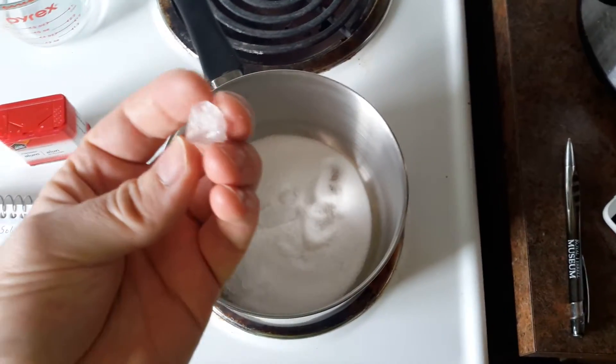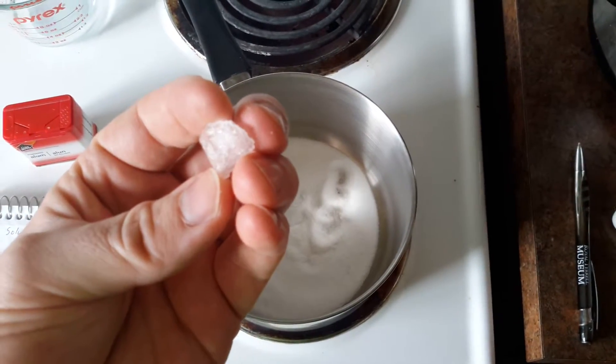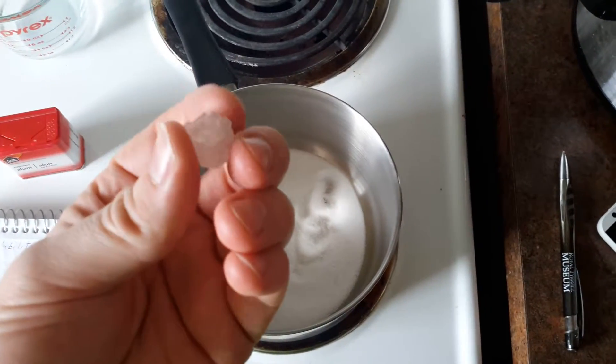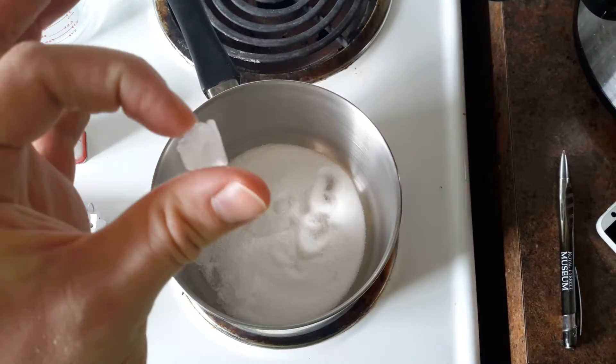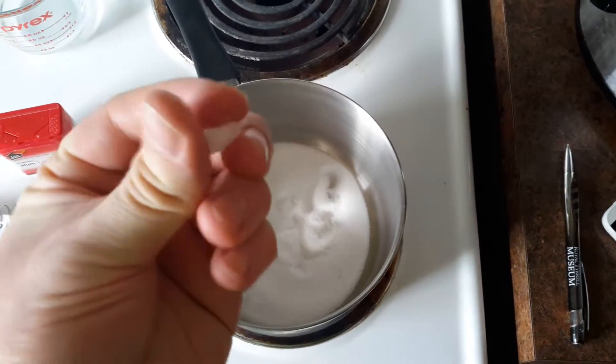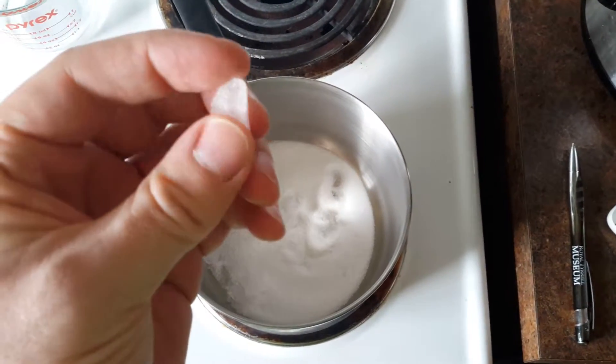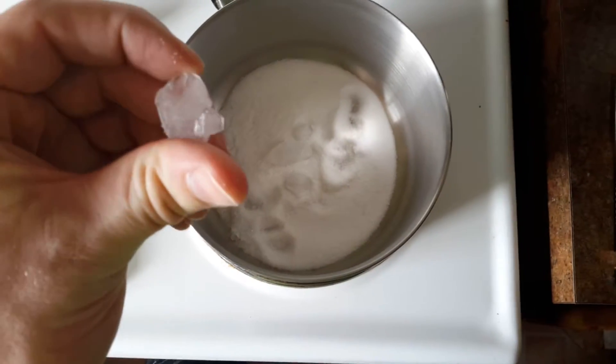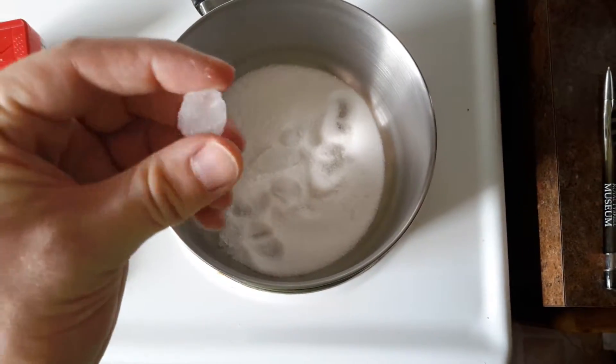Now because these crystals grew from cooling of the solution, they grew very quickly, and as a result they're poorly formed. You can see they're cloudy, not very good optical quality, and there's also stepping of the faces, and there are multiple crystals grown together at various angles.